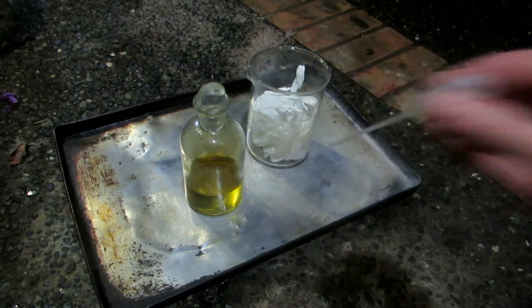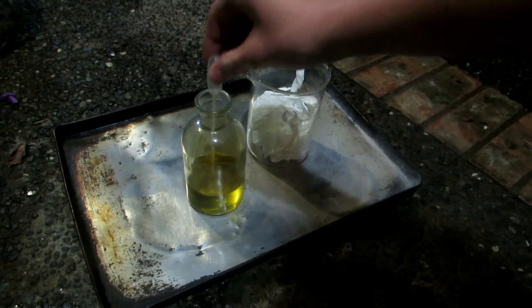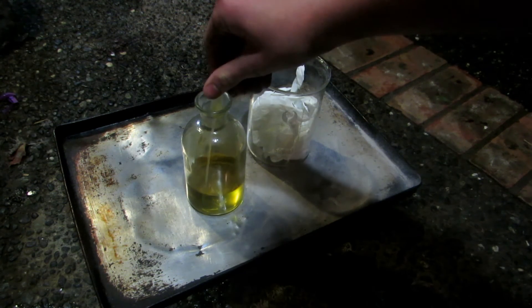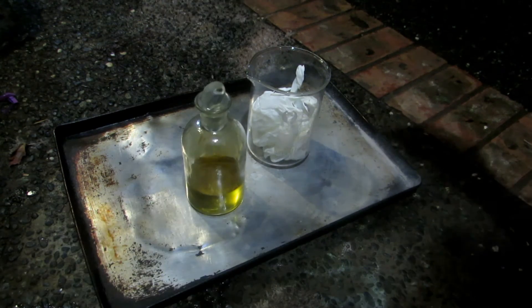So we just have a pipette, and we'll just take one milliliter of this stuff and drop it onto these gloves. Pull up about a milliliter — that's probably about a milliliter there — and we'll just drop it on these.